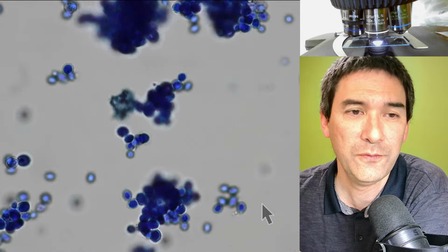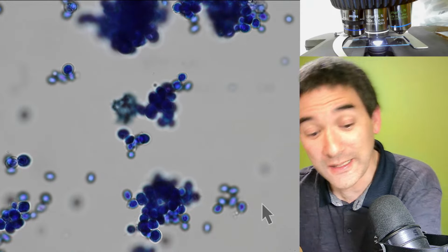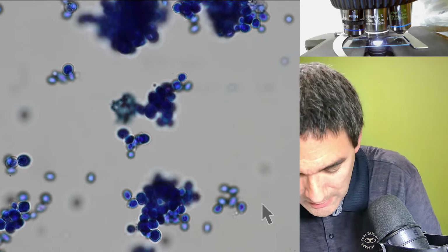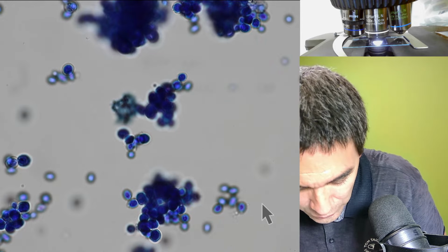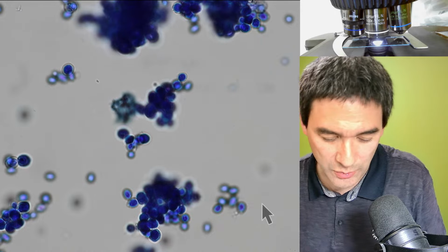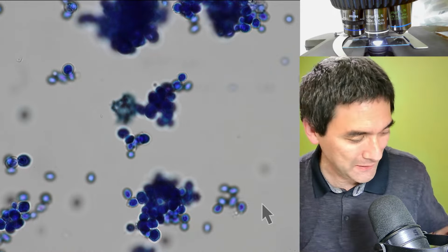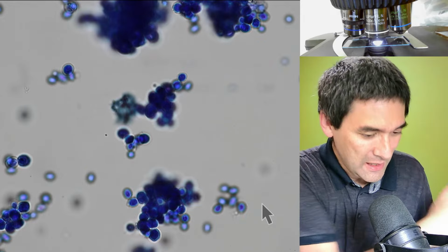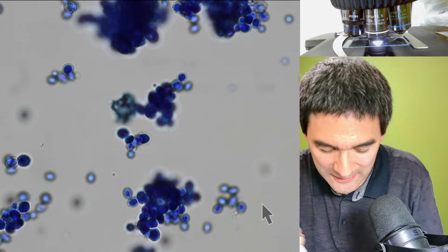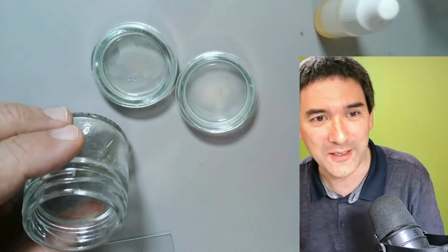Again, here you see the whole thing wiggle around. But I'm still a little bit surprised why there were so many. Or maybe I took the wrong petri dish? No, this was actually this one. I'll try this again. It fascinates me, those algae from the tablet, that they still contained all of these other things here. So I'm going to try this again. It's kind of fascinating.